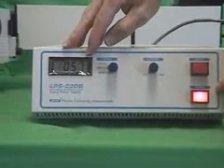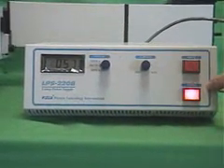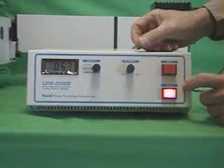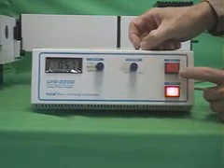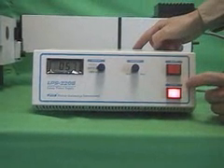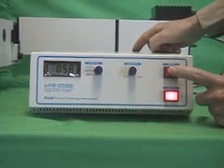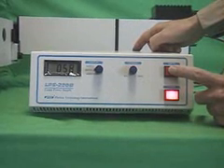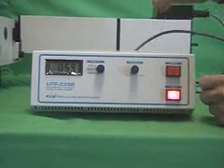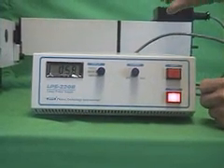The ignite toggle switch on the back has been set to auto. The lamp will ignite by itself in anywhere up to 20 seconds, quite often 3 or 4 seconds. If the toggle switch on the back has been set to manual, then you need to press down the ignite button and hold it down until you notice that it ignited.